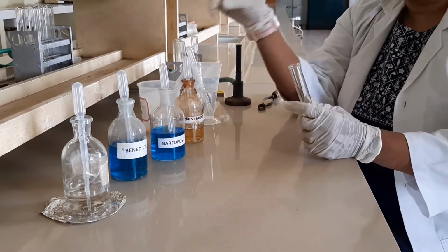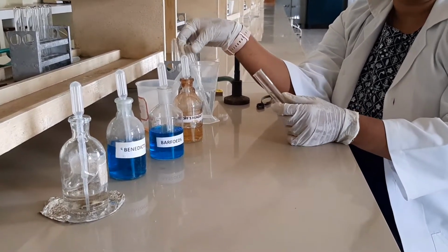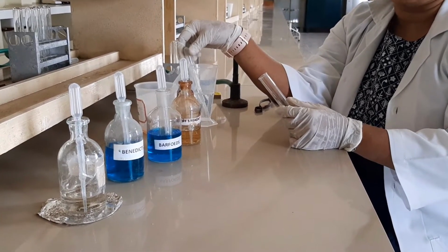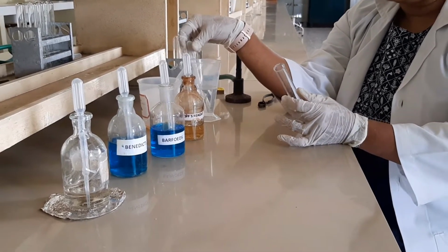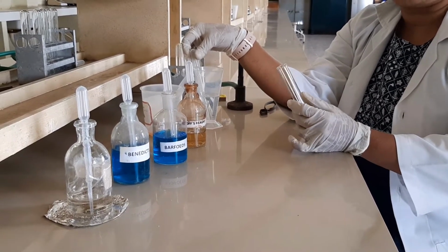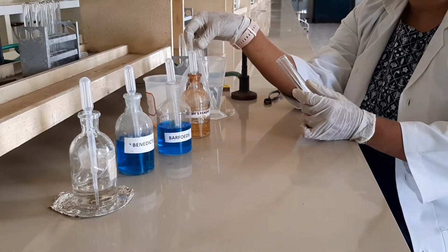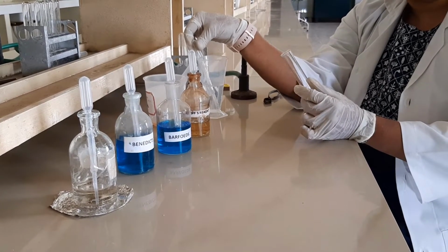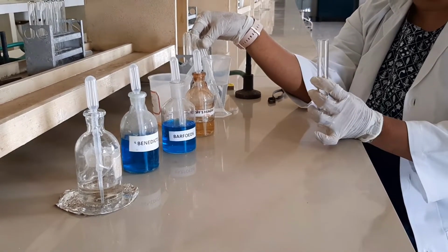The next test is to see whether the carbohydrate is a reducing sugar or a non-reducing sugar. We have 2 types of sugars, reducing and non-reducing. Reducing means the free functional group, aldehyde or keto group, is not involved in bond formation. Examples are glucose, fructose, maltose and lactose, all reducing sugars. But sucrose is not a reducing sugar because the free aldehyde and keto groups are not exposed and are involved in the bond formation. So this test identifies whether the given sugar is reducing or non-reducing.